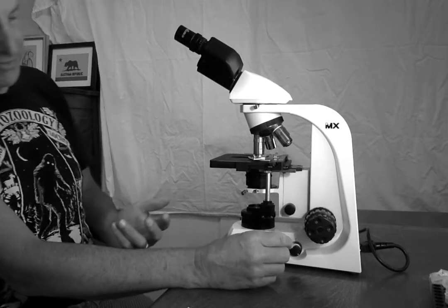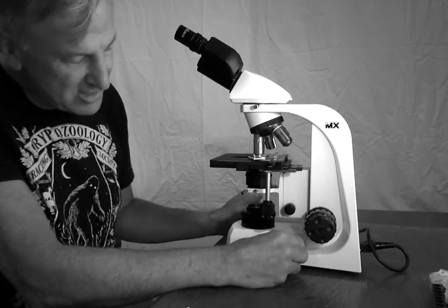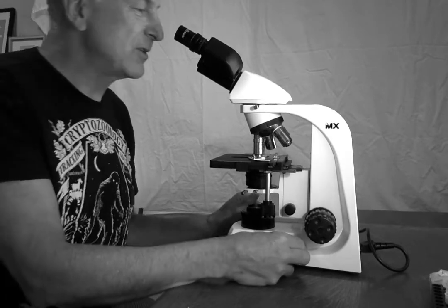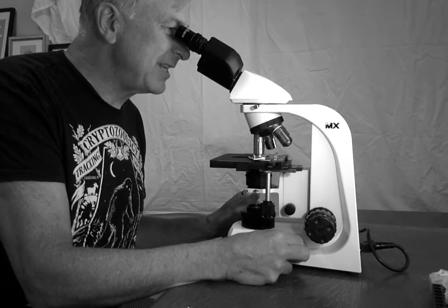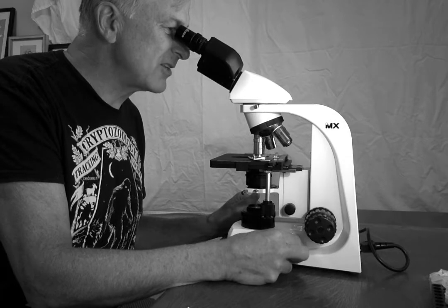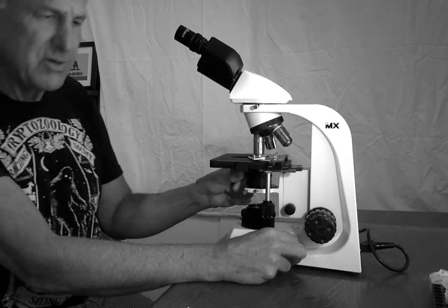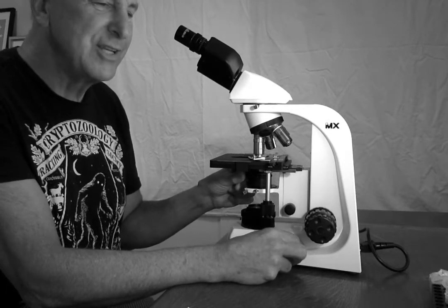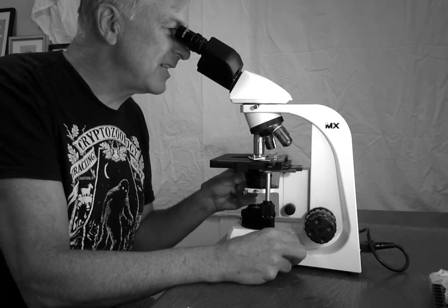Another thing that I should have said earlier is, the other thing I do when I'm looking is I'm adjusting the intensity of light with the rheostat here, because as you darken or brighten, different things will show up, and if it's too bright, it sort of washes out the color. So I play with this a lot while I'm observing, and I also use the iris diaphragm to adjust the light.